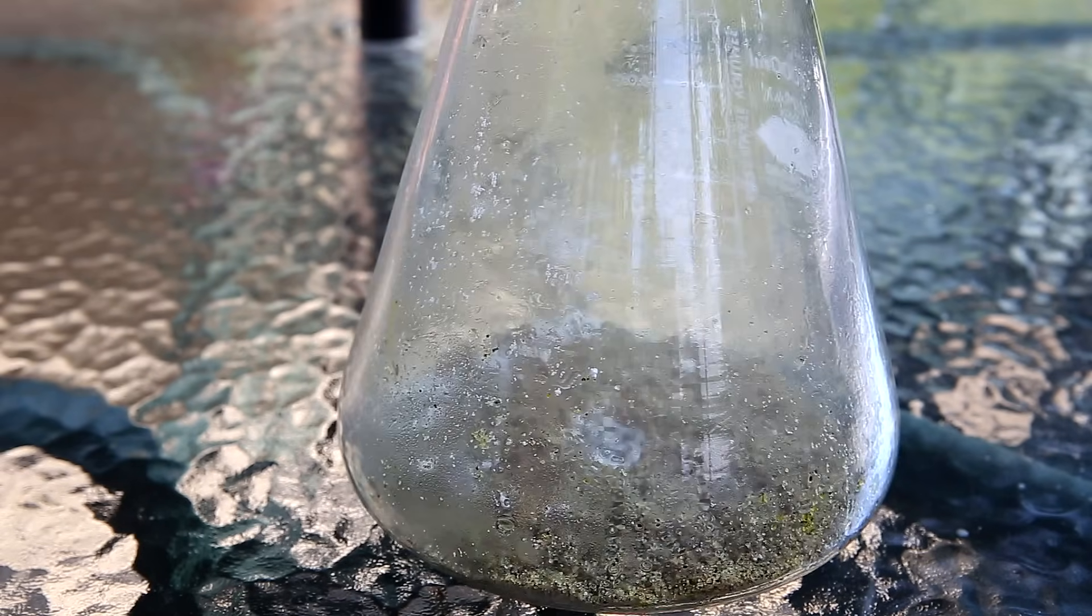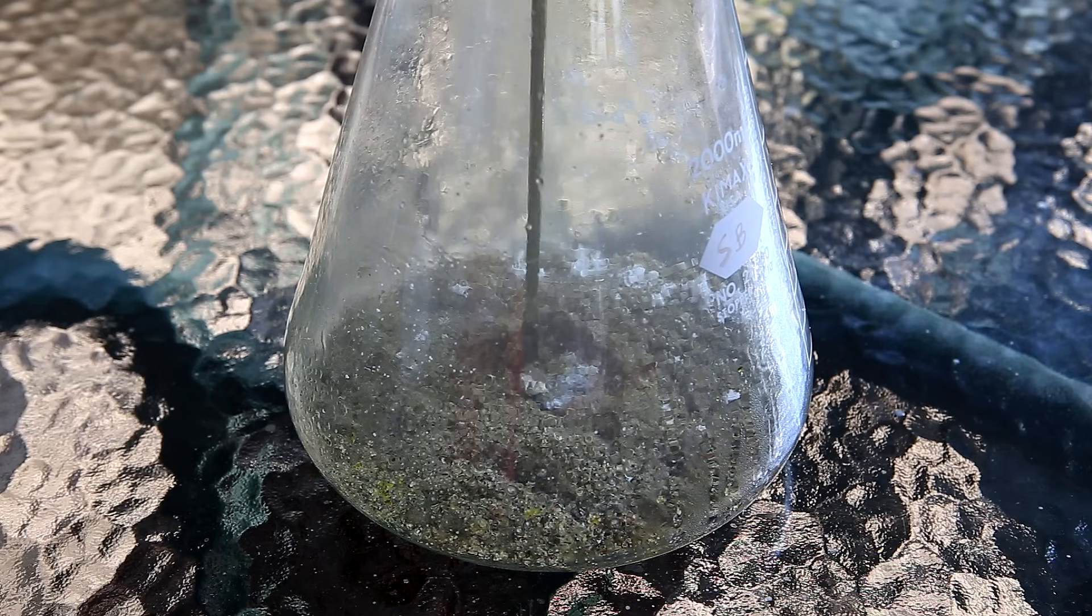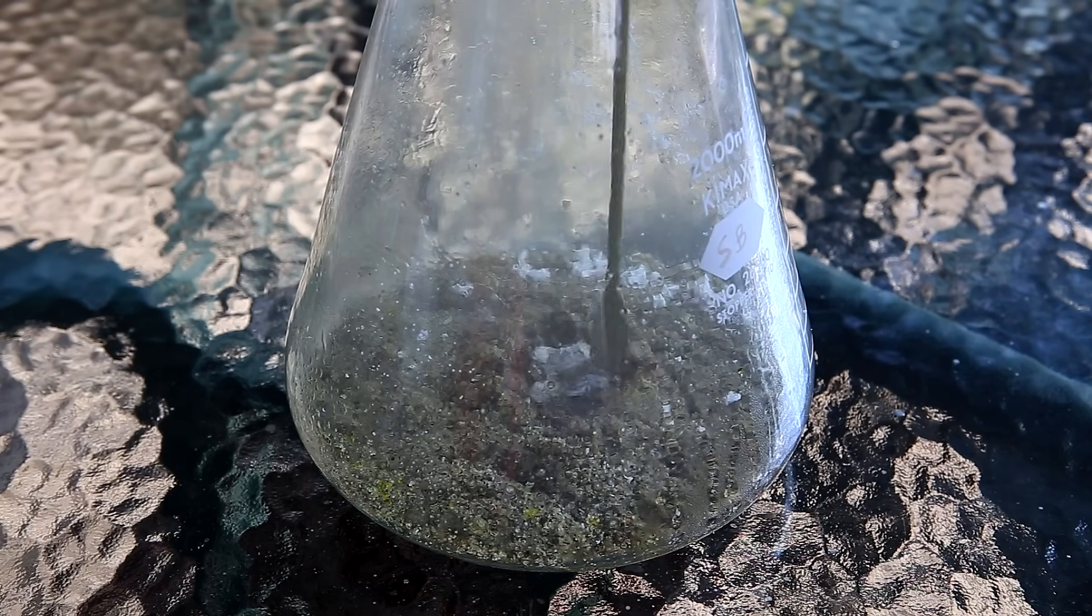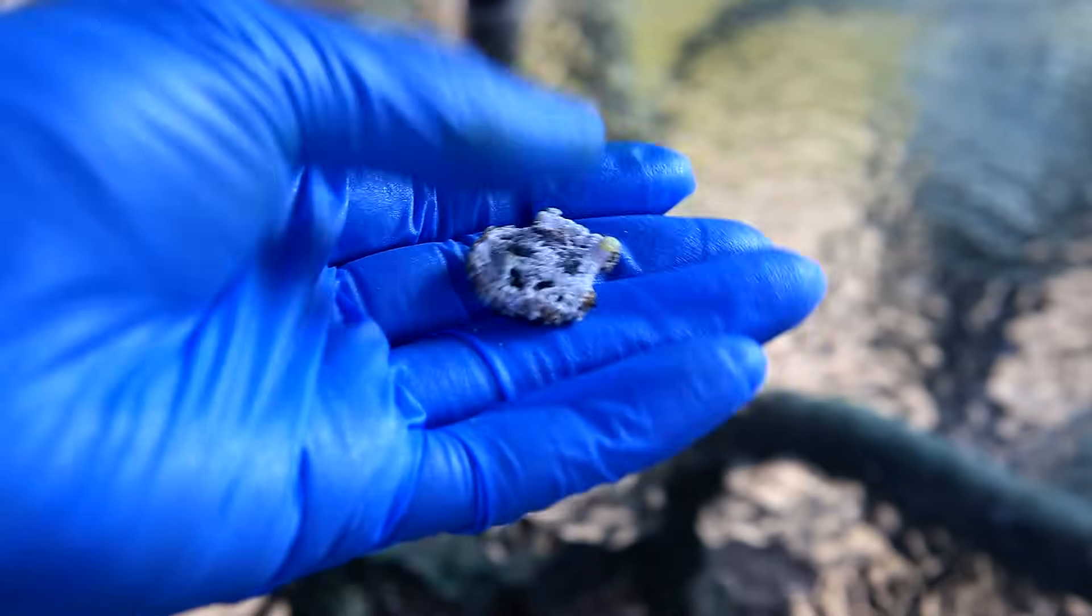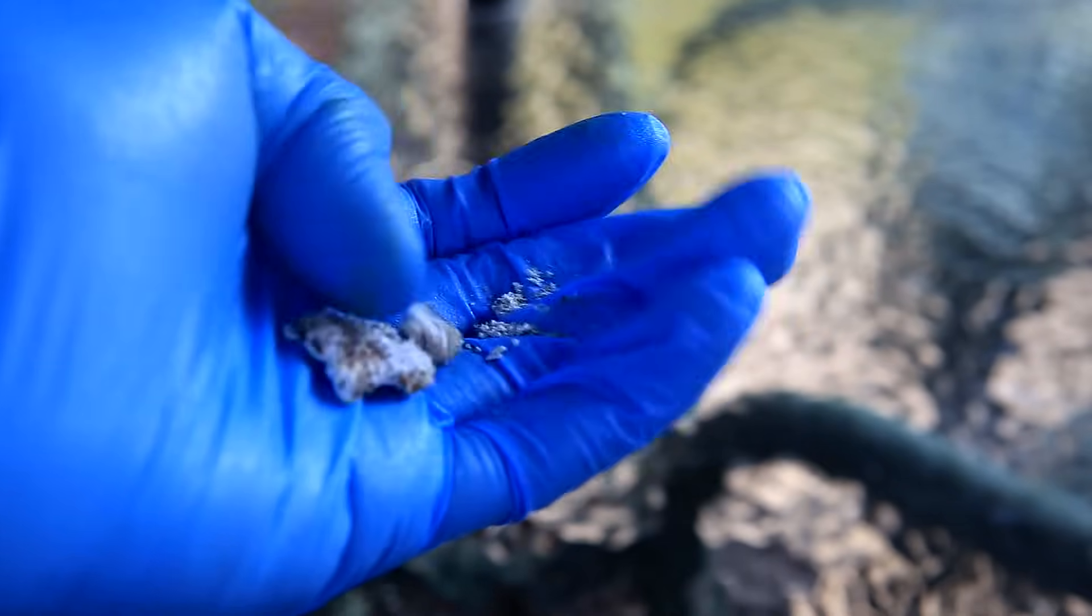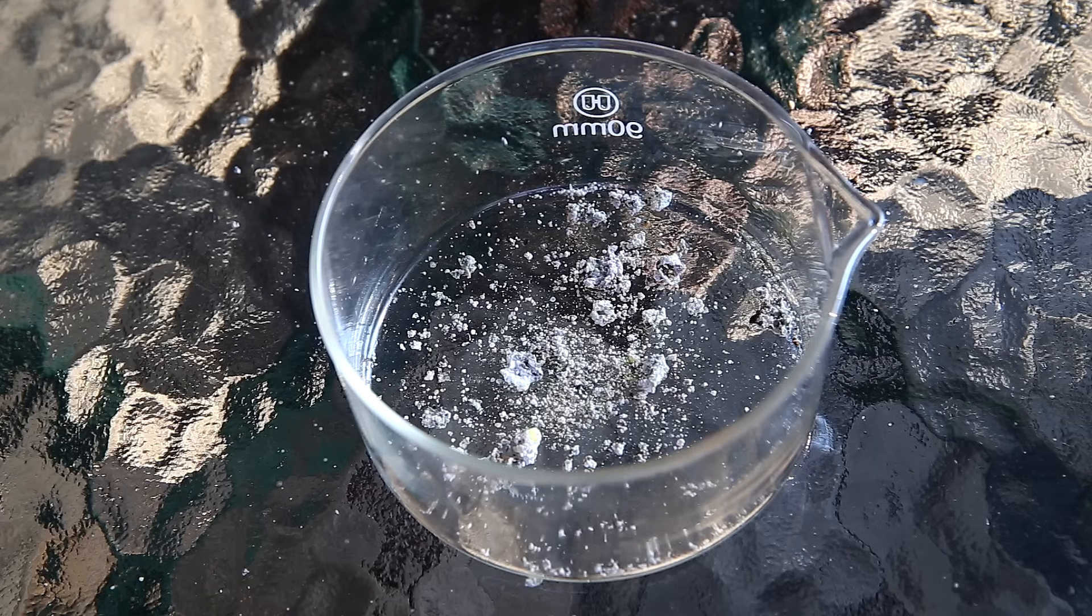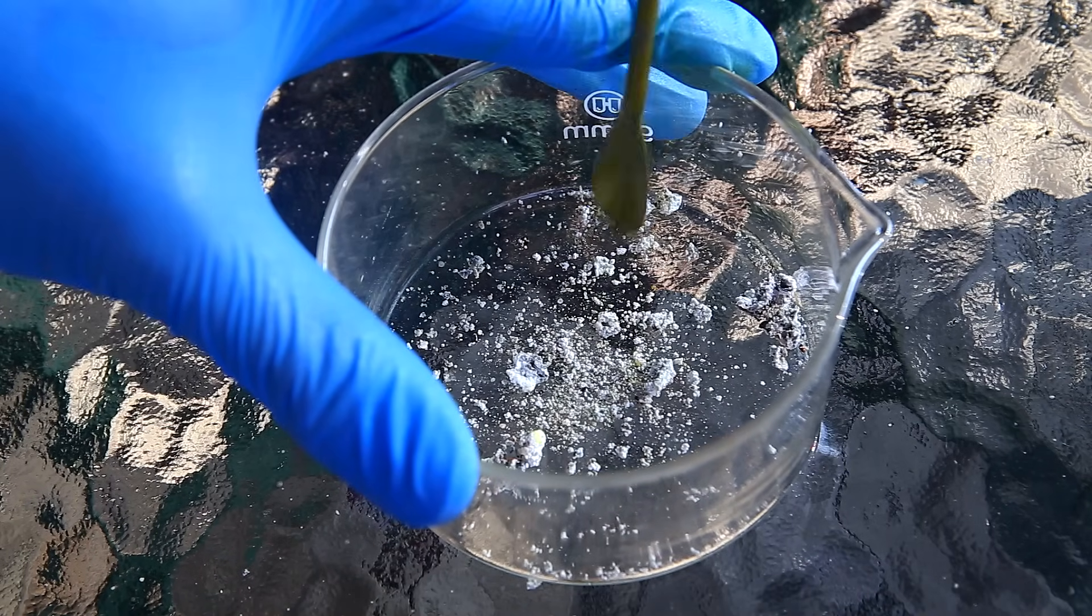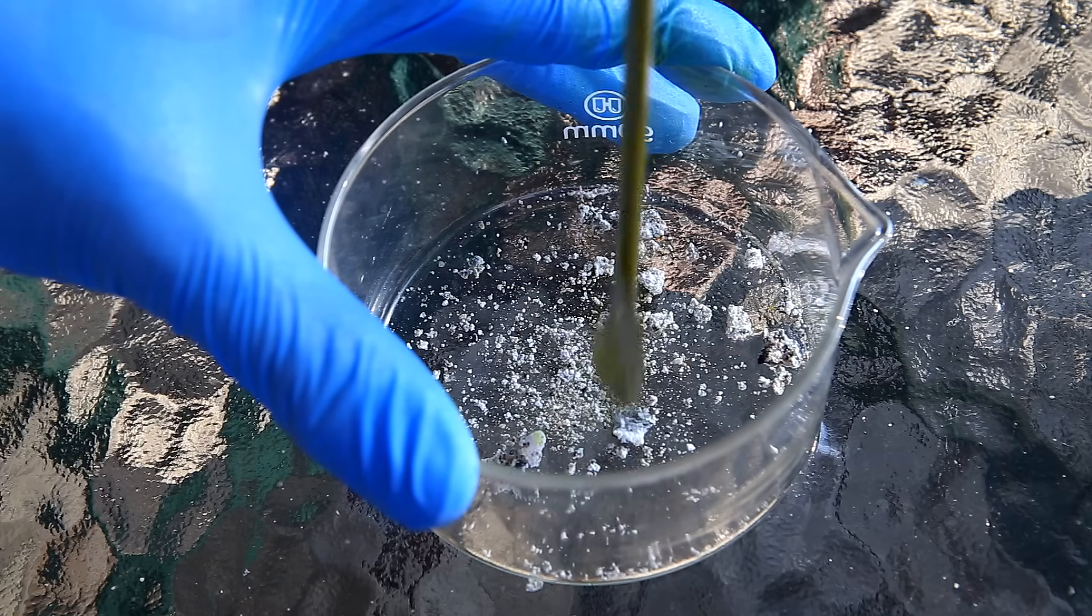The interesting part is that with the second run, since the sodium stayed in one place, I was left with a solid block of sodium chloride at the bottom. Unfortunately, because the sodium was reacted in sand, it's highly contaminated with it. So you can see here that when it's broken up, that a good portion of it is sand. I really did want to get the sodium chloride as pure as possible, so I opted to carry out the experiment again using the second most common method.